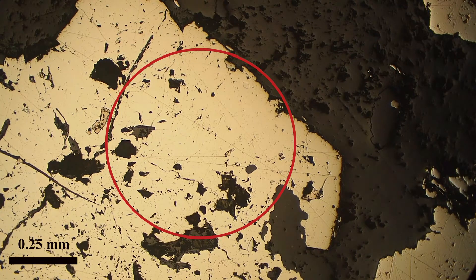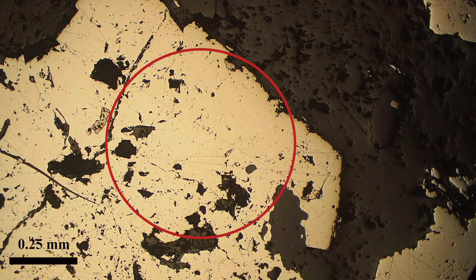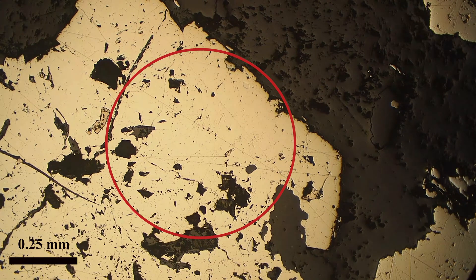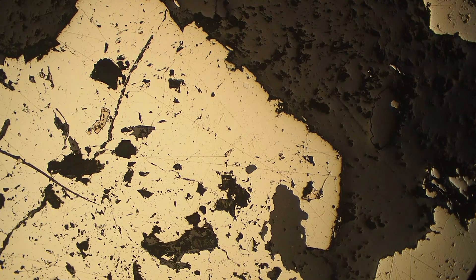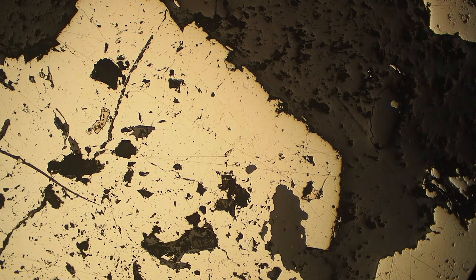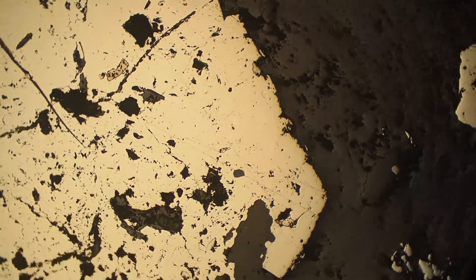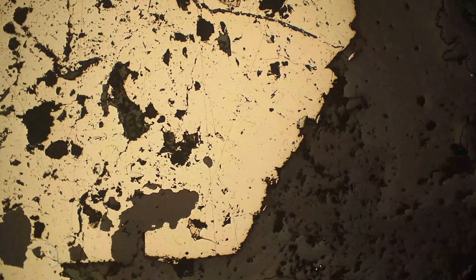Hi everyone. Today I'm going to tell you how to identify pyrite in reflected light. So here is a pyrite crystal. It's fairly distinctive in that it is hard, so it'll take scratches really well, so it's often fairly scratched.